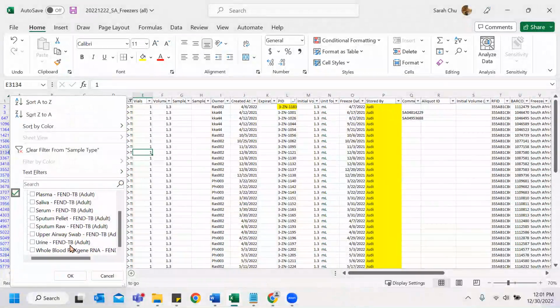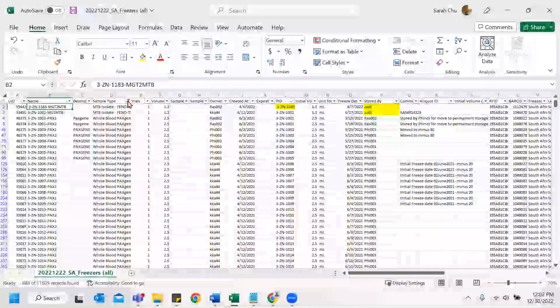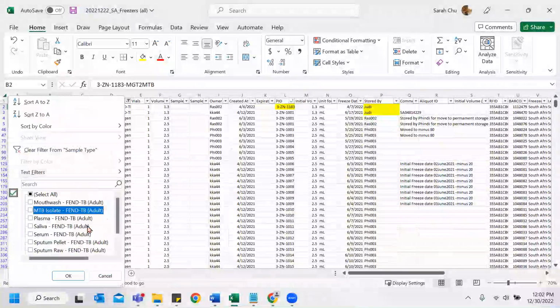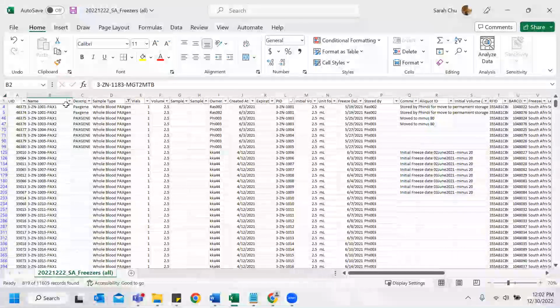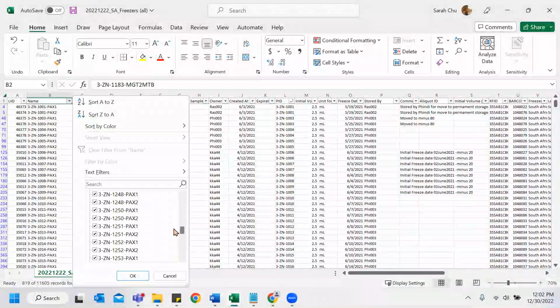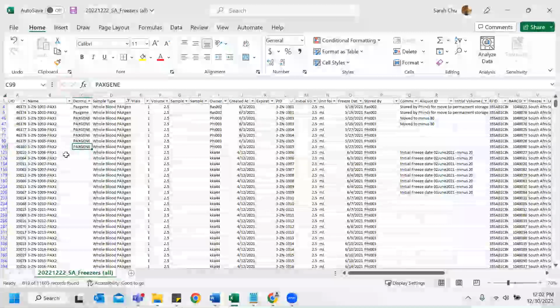Let's do whole blood PAXgene RNA. You can see, oh, why is it not showing? Oh, because I accidentally did this. PAXgene RNA, let's do the same thing, look for blanks. Nothing seems out of the blue. It's in chronological order, description.